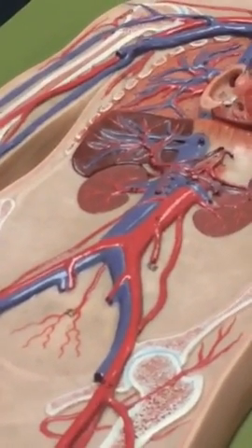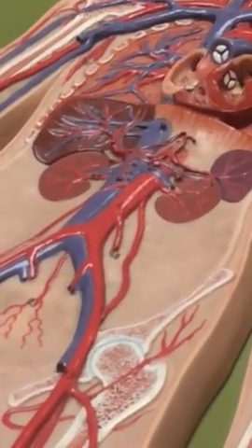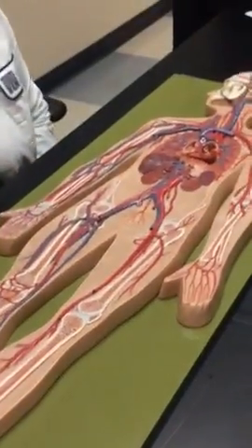And then superior vena cava. No, we're going to go backwards totally on the veins. Start at the bottom and go up. Remember, the arteries take blood away from the heart, and now we're going to come back to it. Okay, so the right and left common iliac vein. No, no, no. Just all the way up.